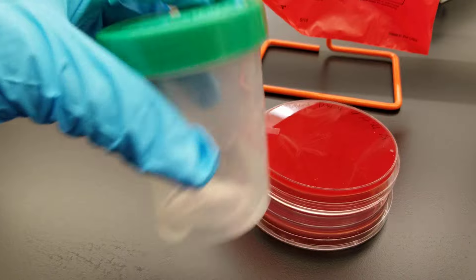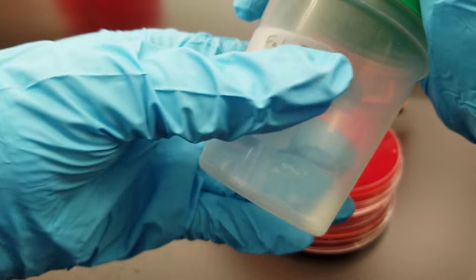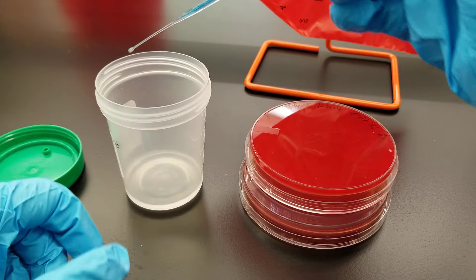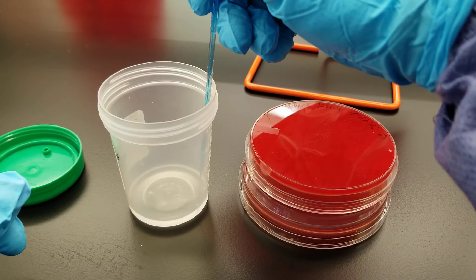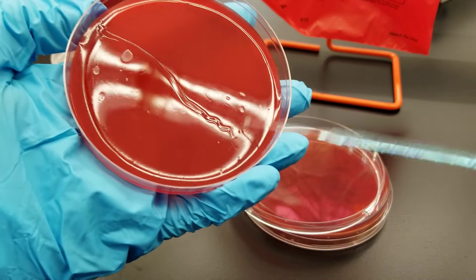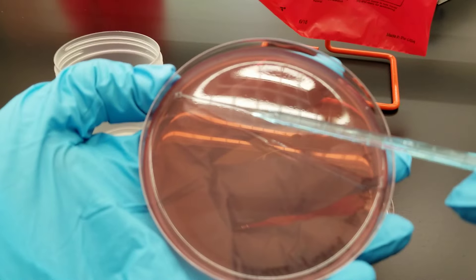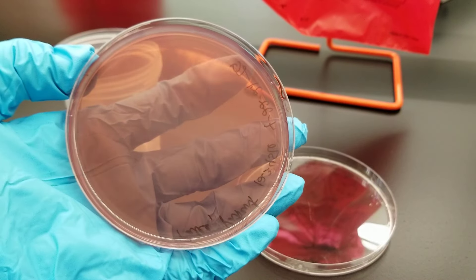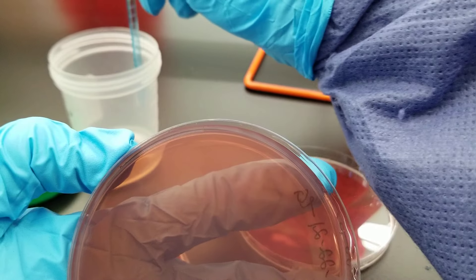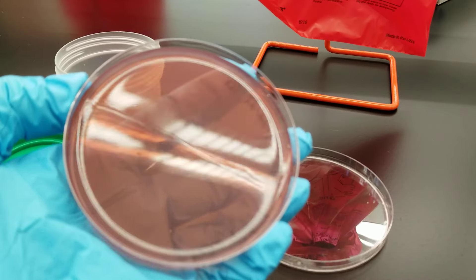There are a lot of scenarios that could happen, but we'll just do one today. First we swirl to make sure we mix that specimen really well. Then we go ahead and dip our loop, making sure we get some in there. We're going to do a line down the center of the blood agar plate and a line down the center of our MacConkey plate. You can see that I didn't really get too much there, so you could instead dip it again before you put it on the MacConkey plate.